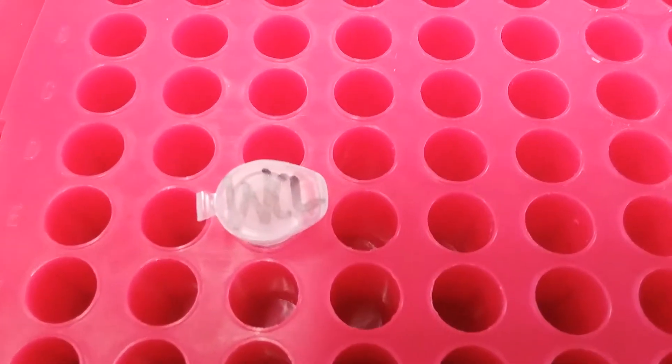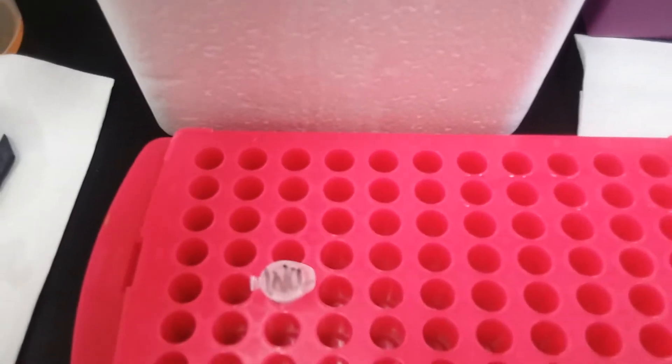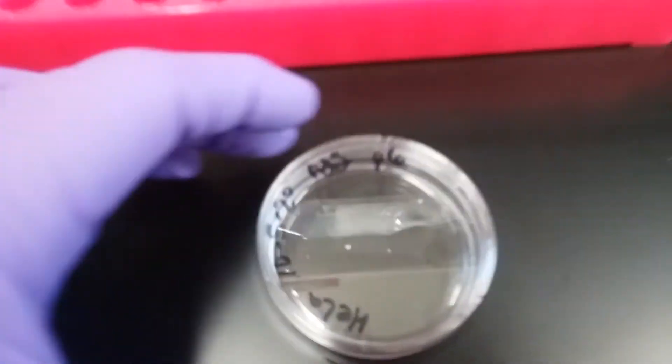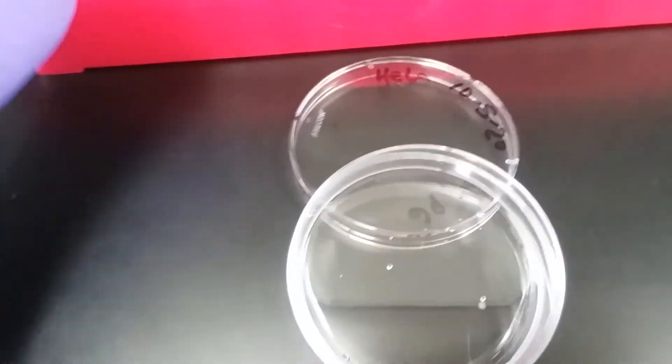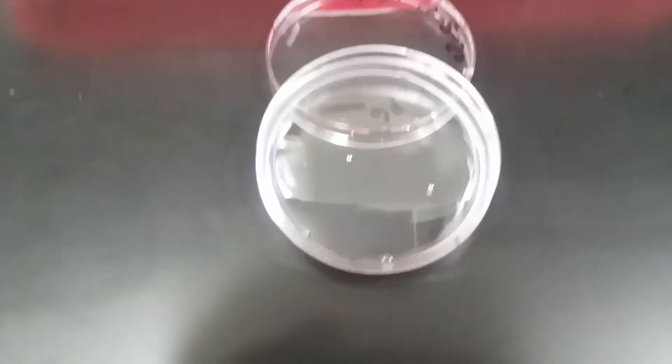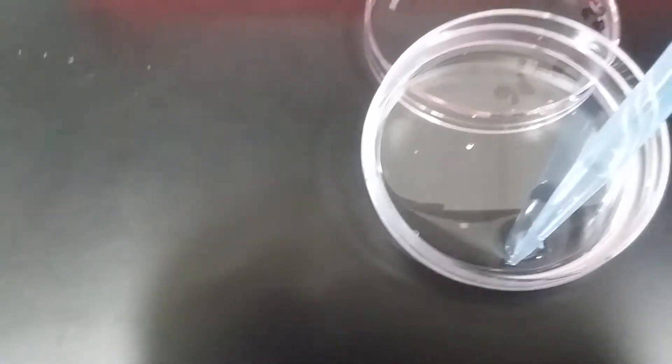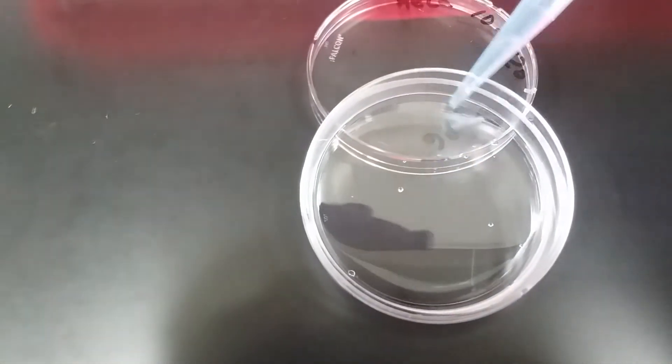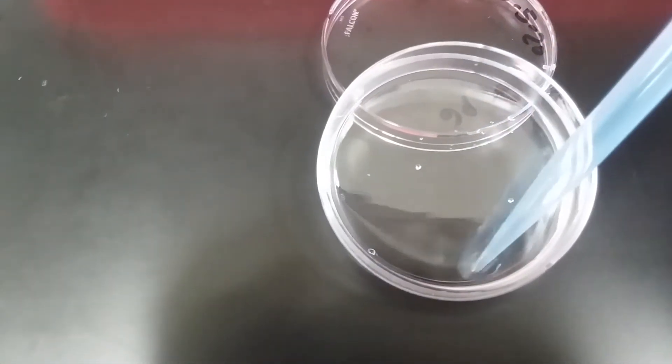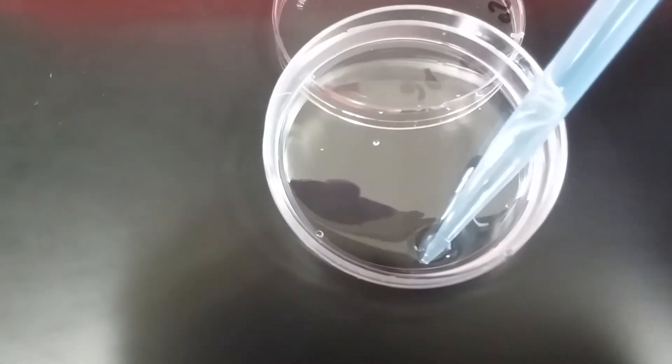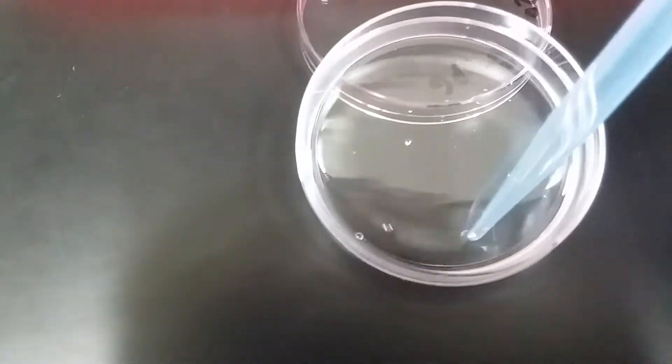So I labeled the temporary tube WCL. I will be getting rid of it at the end, and I'm going to take this C60. I'm going to use the lid to give myself a little tilt, and I'll use my pipette man to kind of suck up that whole cell lysate. I kind of wash the C60, one, two, three.